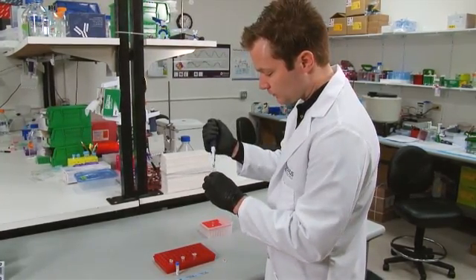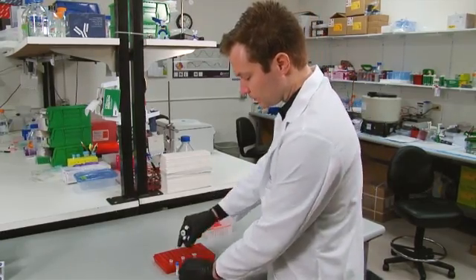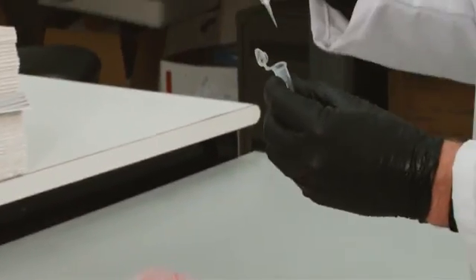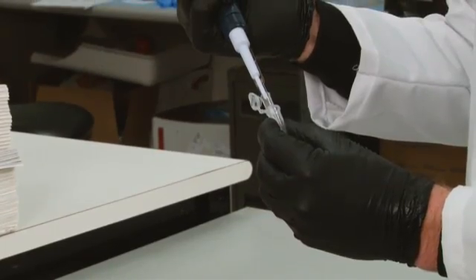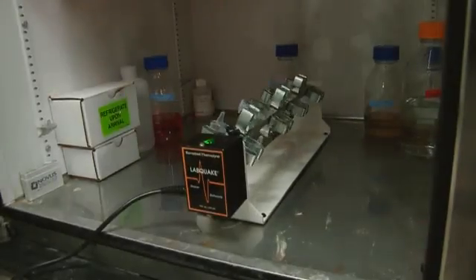Add your antibody of interest and positive control antibody to their respective diluted samples. Then incubate overnight at 4 degrees Celsius with rotation.